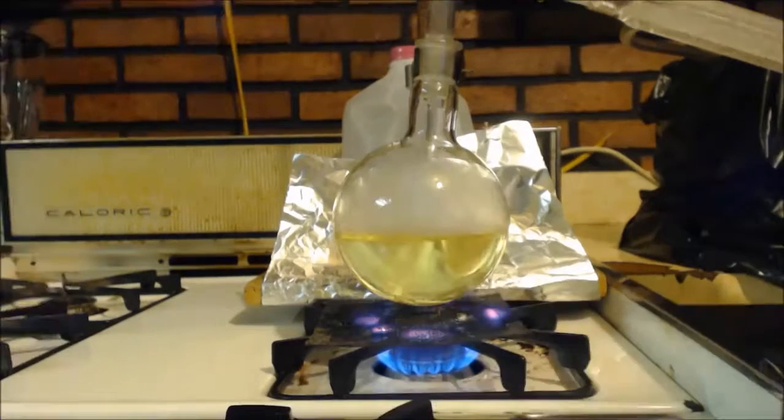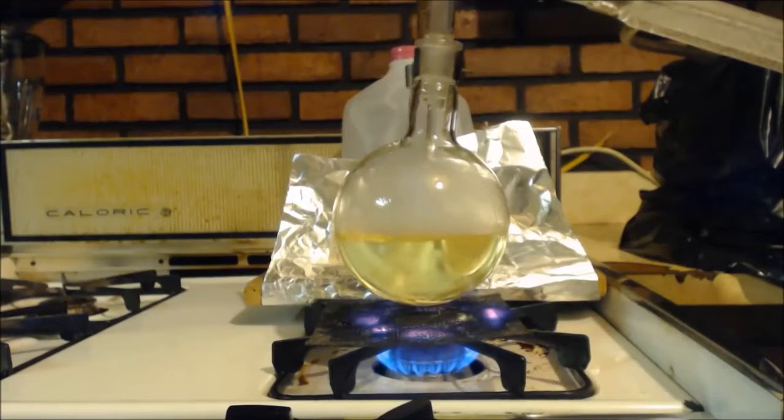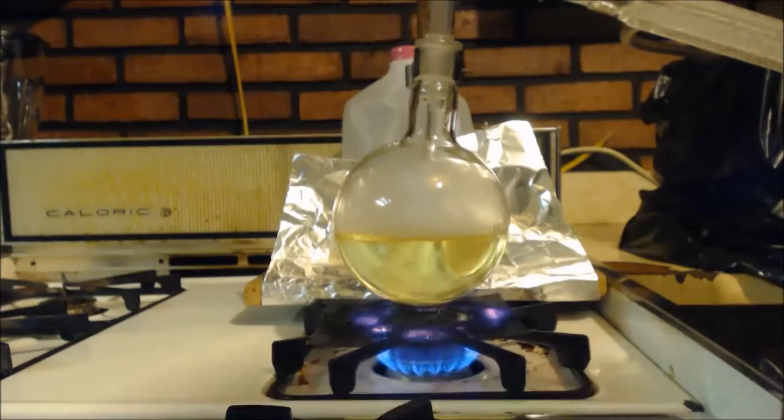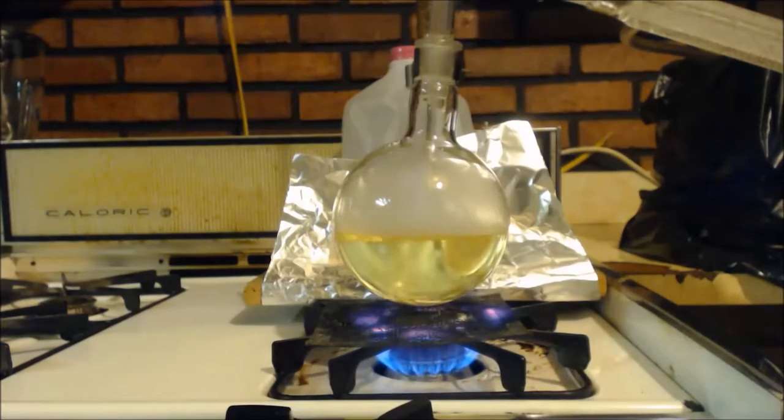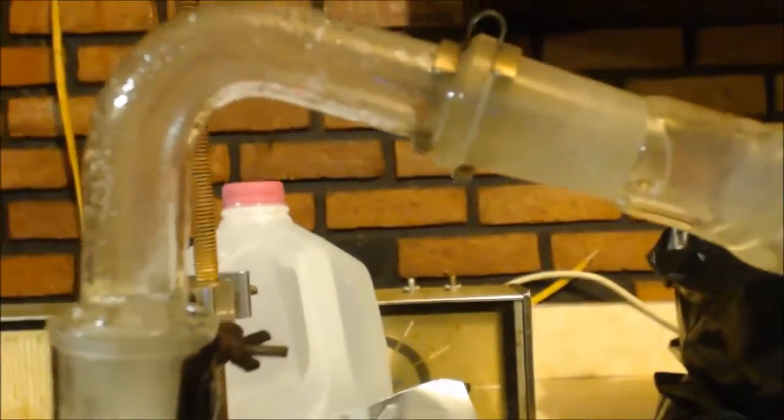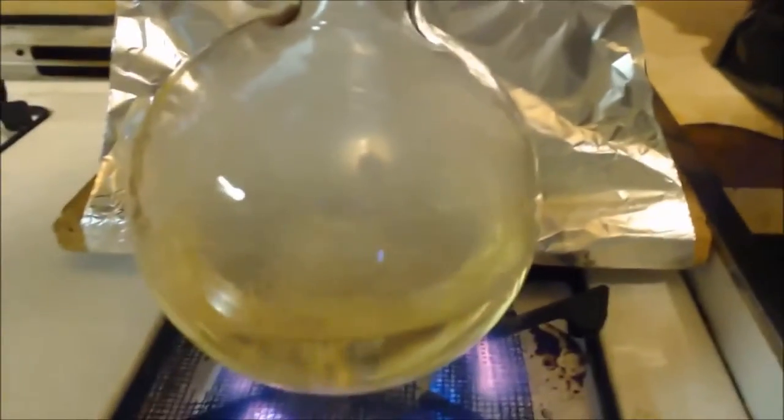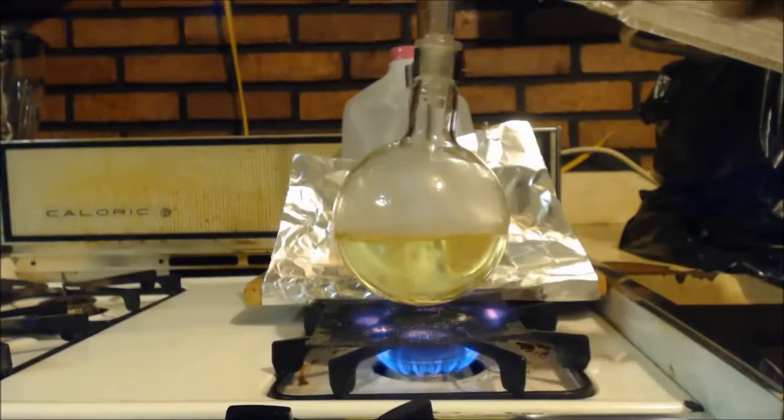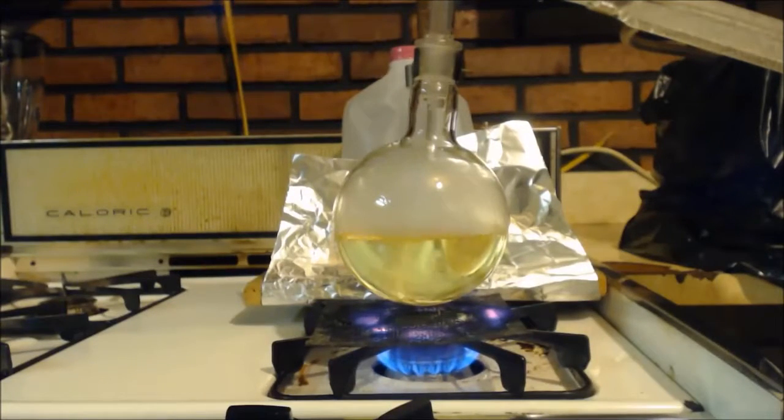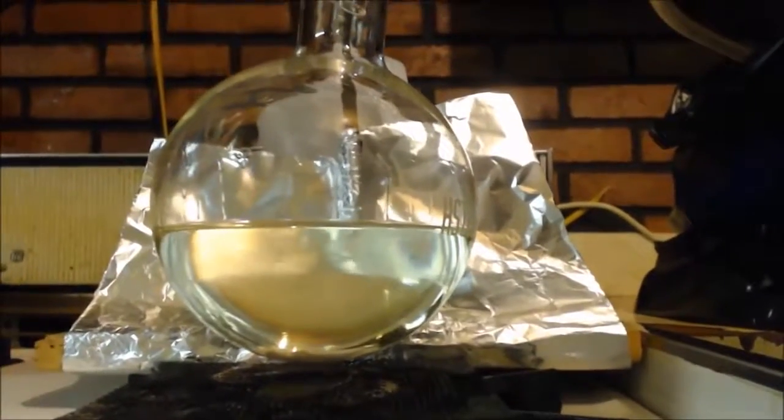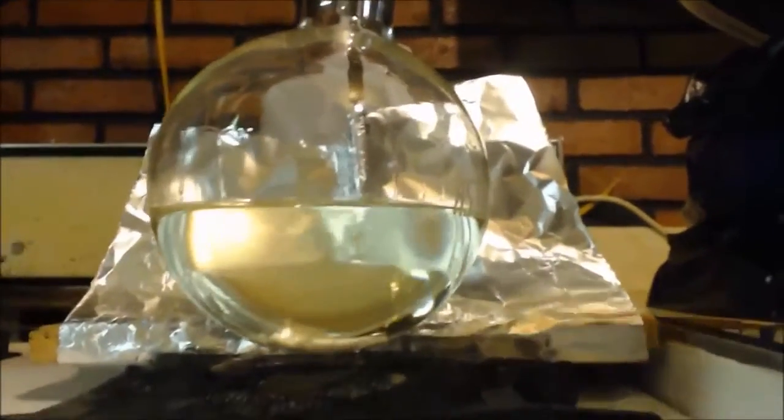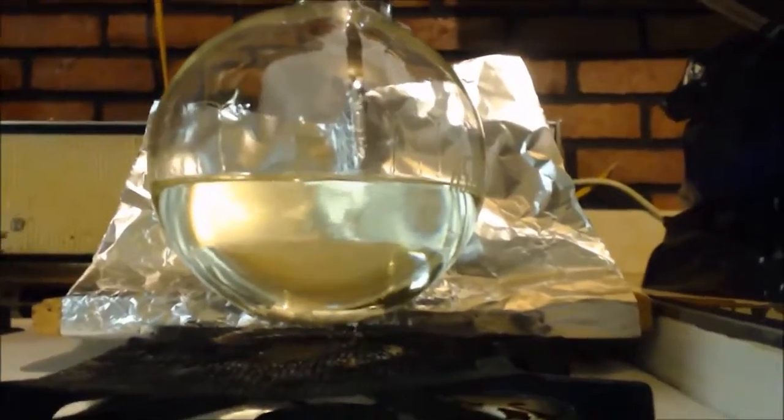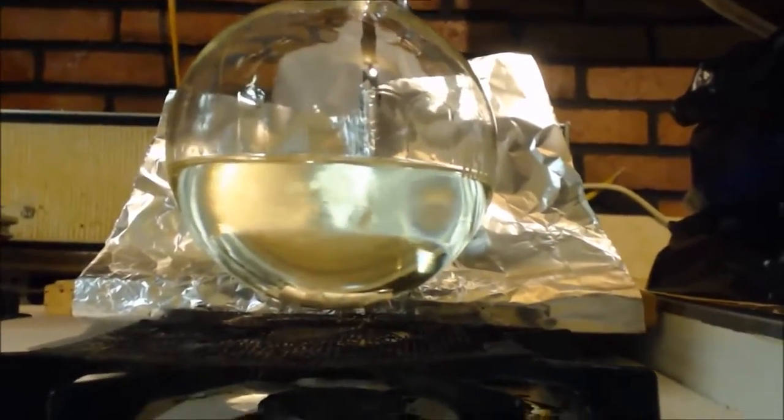Well, it's been boiling about a minute or so. It's about 300 Celsius. It's still yellow though. It's distilling over a little bit of water. I usually do it until my glass starts coming apart the joints. It's only cooled down a little bit and it's already cleared up a lot. By the time it hits room temperature, it should be almost crystal clear like water. Well, that's right. Clear.